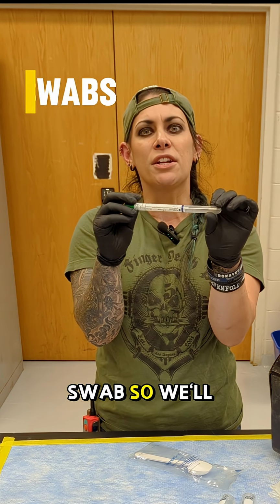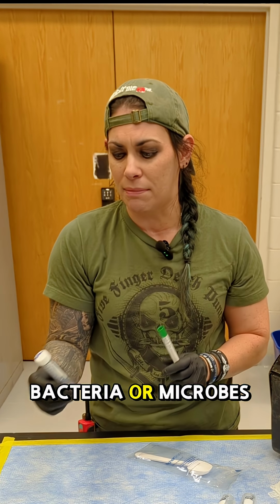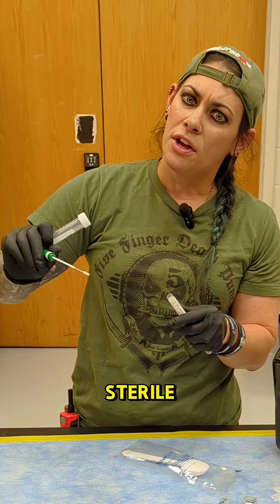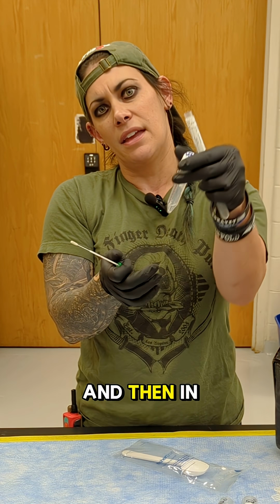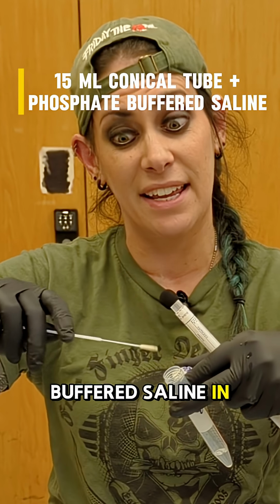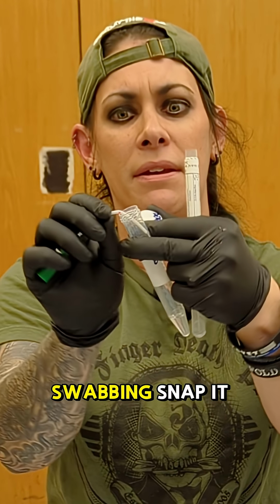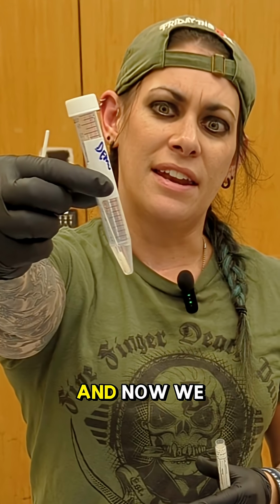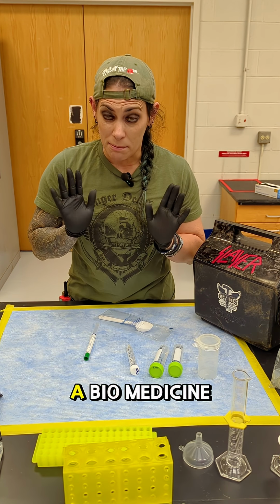This is a swab. So we'll swab the cave walls or the speleothems to collect surface bacteria or microbes. And the way we do that is we'll open up our swab. It's nice and sterile. We'll spin it around and get all over the wall or speleothem. And then in our 15 milliliter conical tube that has phosphate buffered saline in it to keep those microbes from totally drying out, we'll stick our swab in, snap it off, screw the lid on, and now we have our swab sample.